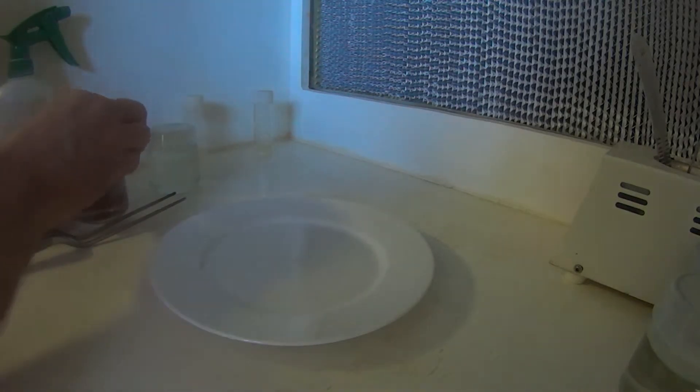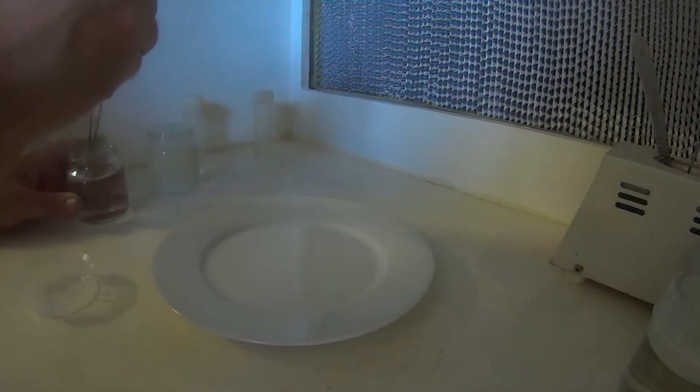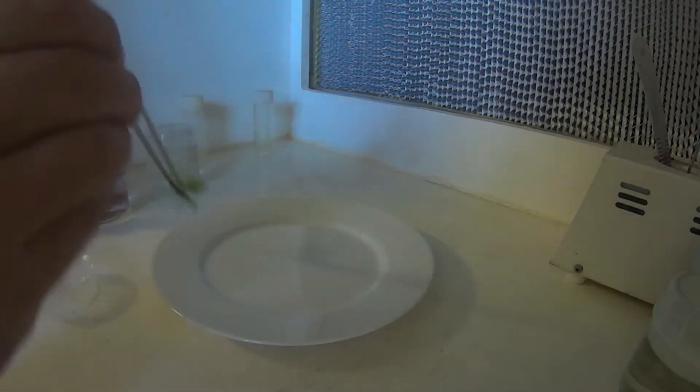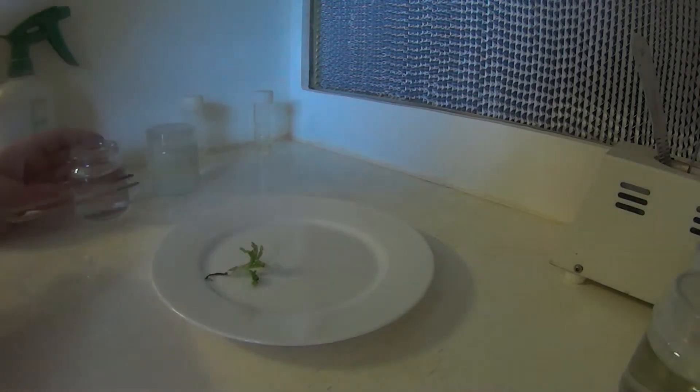All right, today I'm just going to run through getting some Venus Flytrap into tissue culture. There's a little plant that I removed from another plant outside.